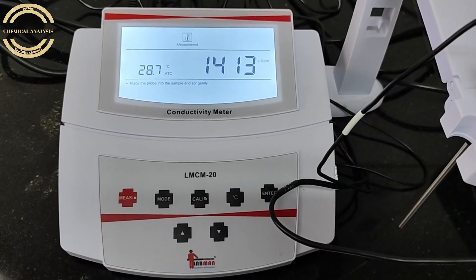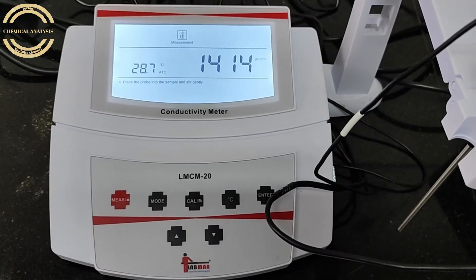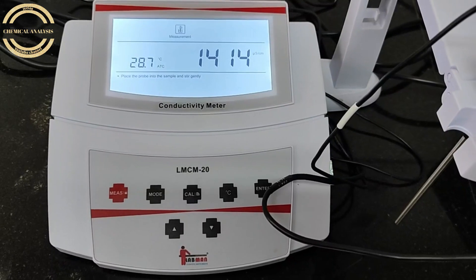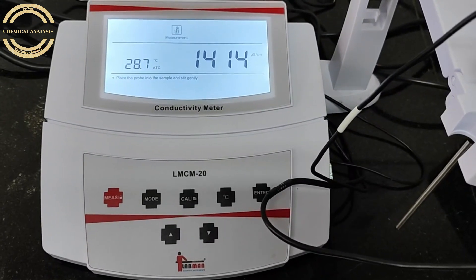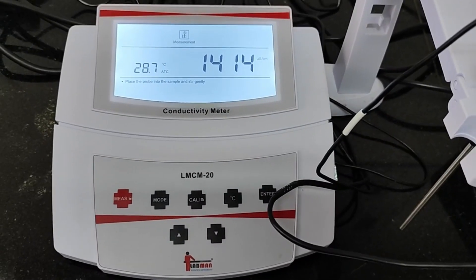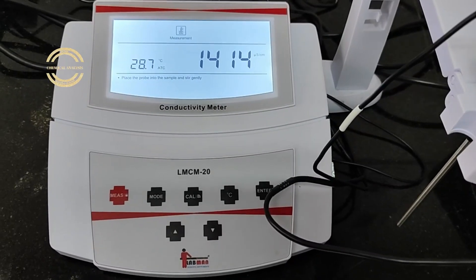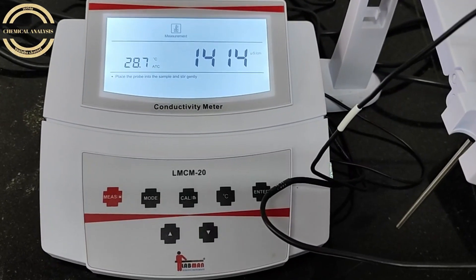Check the reading. The instrument shows 1413, 1414, or 1412. If the reading is in this range, the instrument is calibrated well. Now we are going to sample analysis.